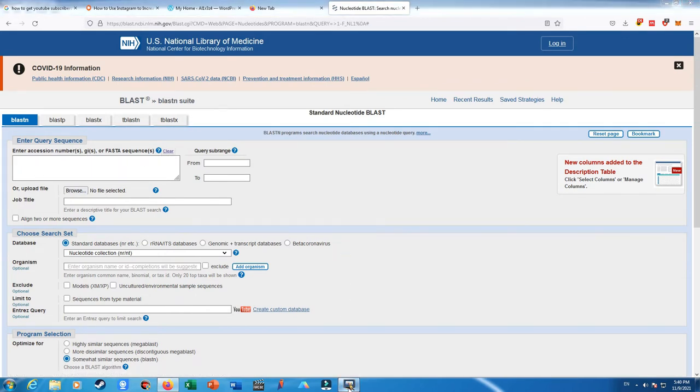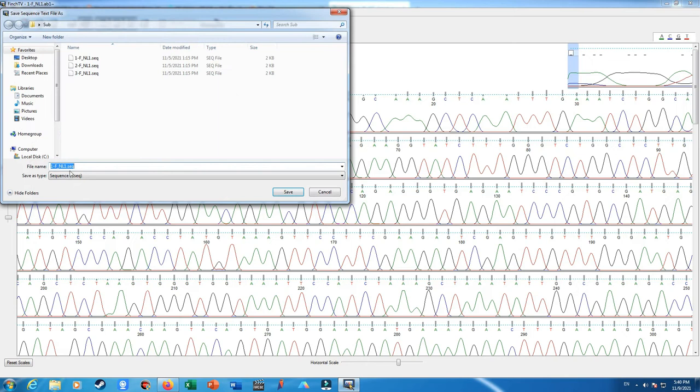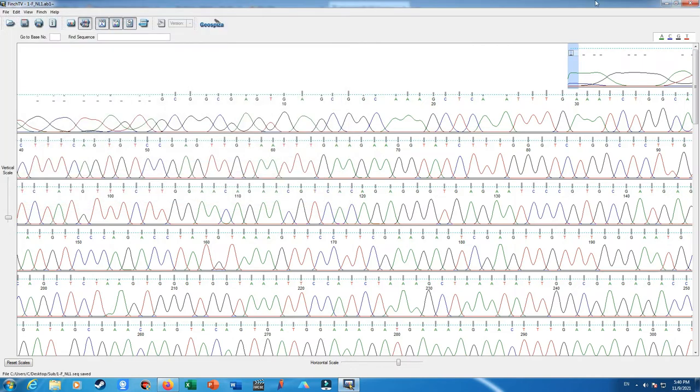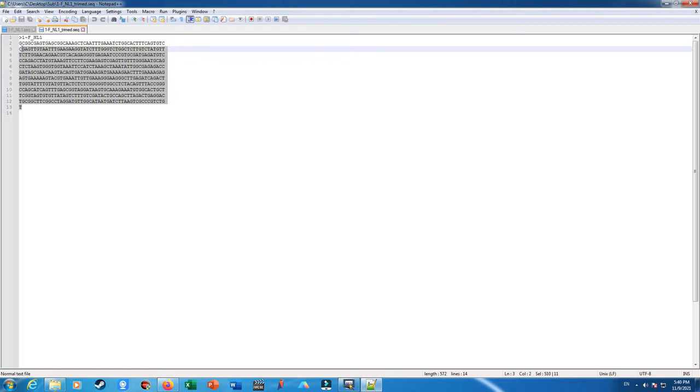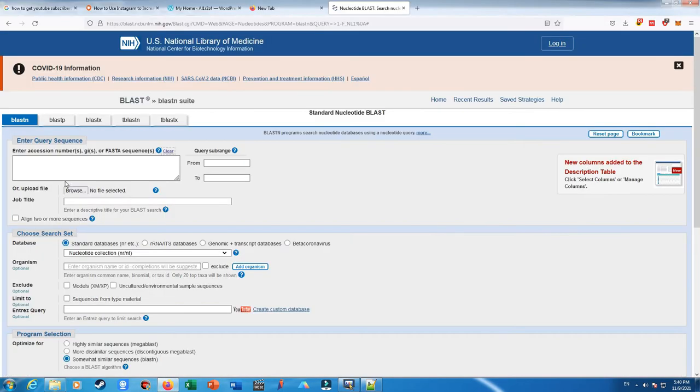I cleared the entry, going back to the FinchTV file, export DNA sequence, FASTA file. I named it 1FNL1 trimmed, which I have trimmed the sequence, saved it. Okay, let's copy and paste it into the enter query sequence.